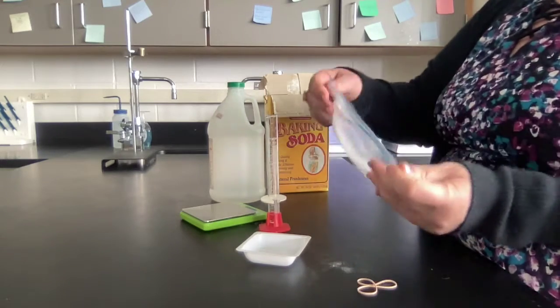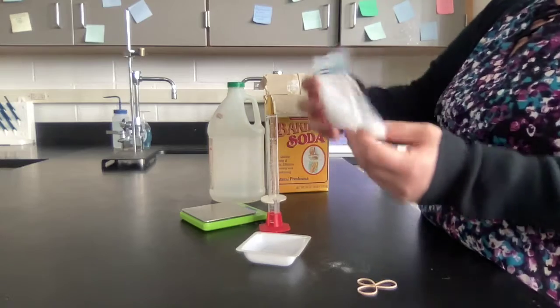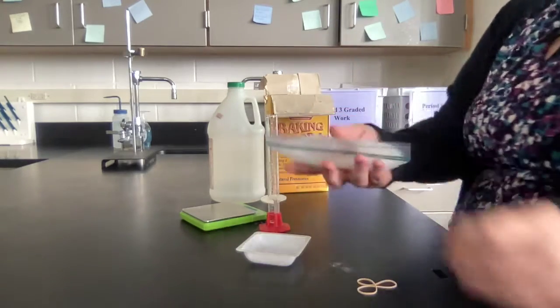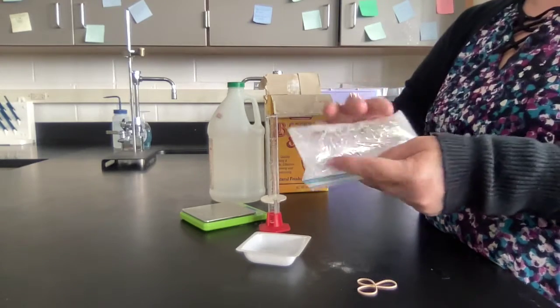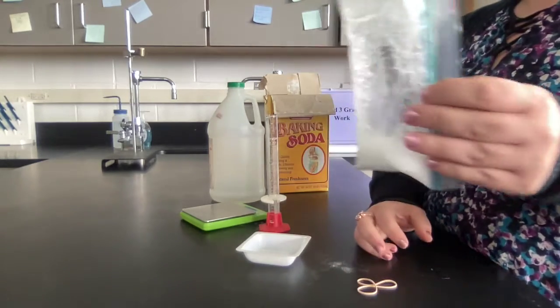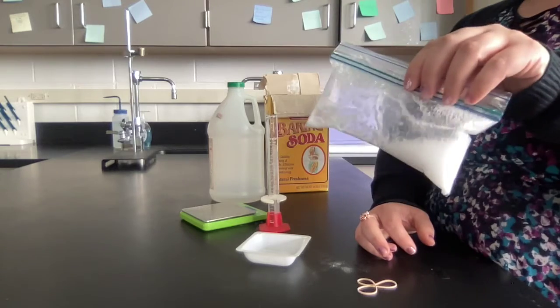And then I'm going to mix them together. Once it is sealed, I will mix them together and let the whole reaction happen. So you can see as it's happening, the bag is filling up with gas.